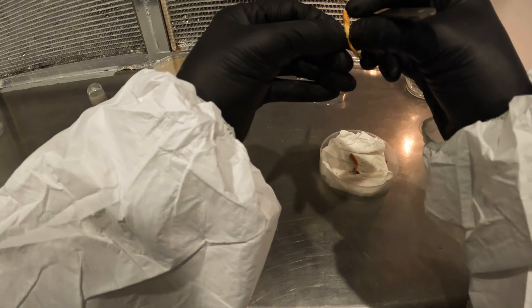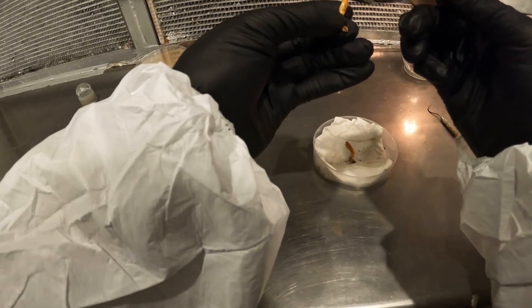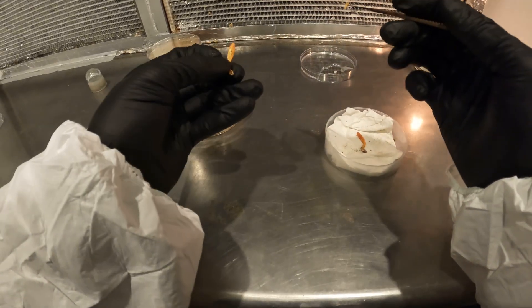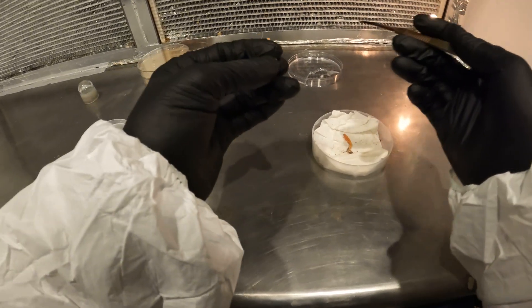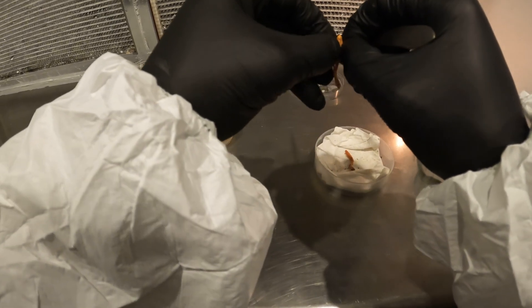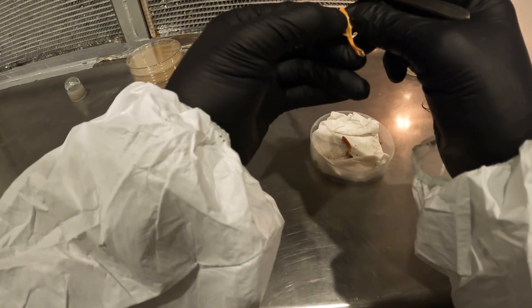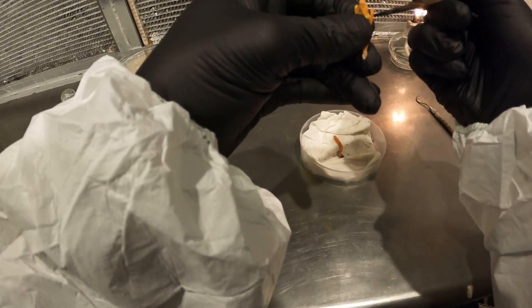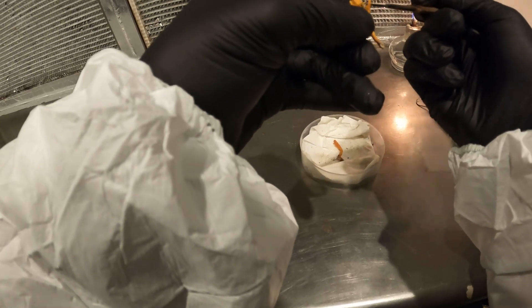When they're regrown back out, they're regrown without the bug. I did this last year and I still have the culture alive — I've been transferring it a bunch on the agar. With these I didn't put them in the peroxide; I'm just trying to get a clean tissue sample out of the middle. We'll know in about a week — sometimes just before that they'll start to germinate. If there's any bacteria or contamination, those usually show up a lot faster, which is a little annoying.